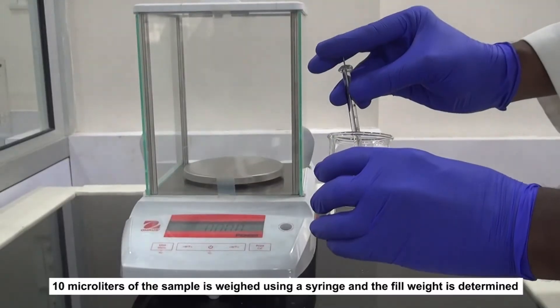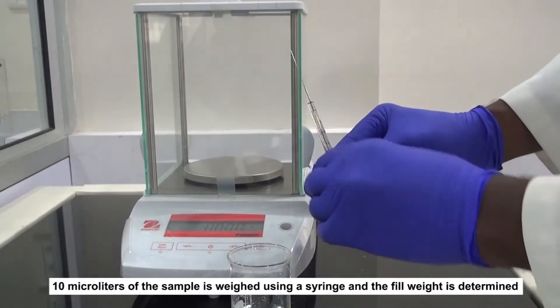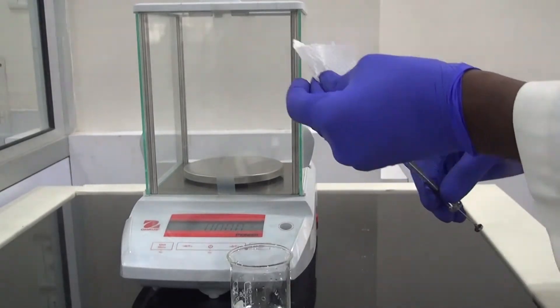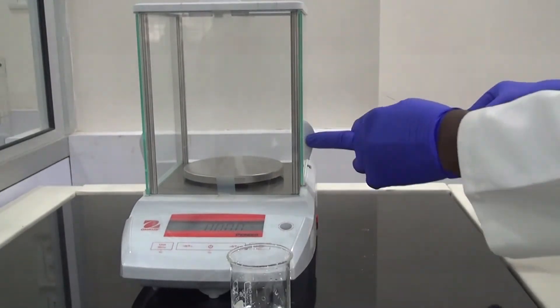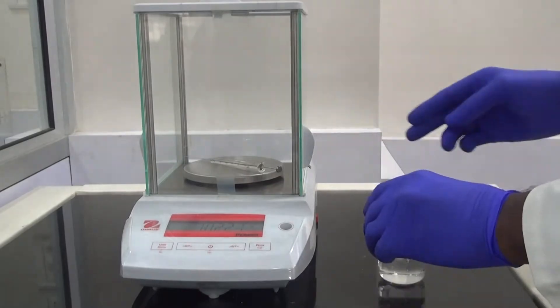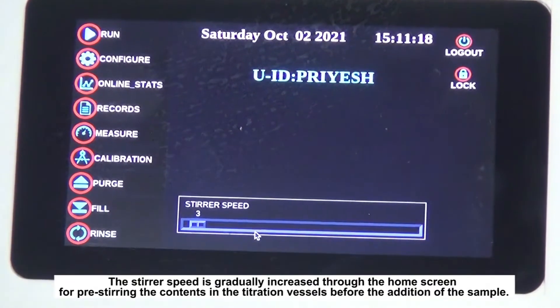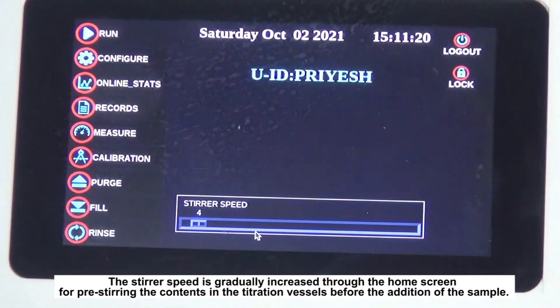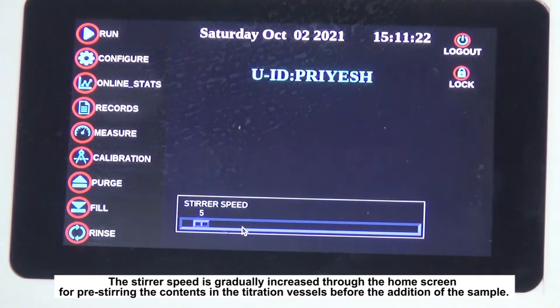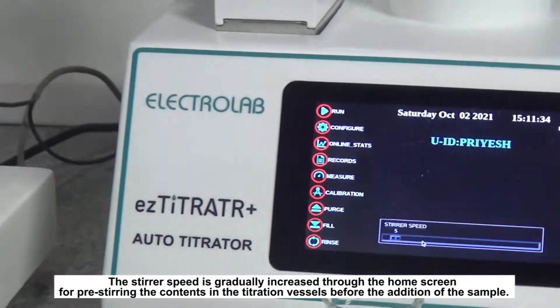The sample is weighed using a syringe and the fill weight is determined. The stirrer speed is gradually increased through the home screen for pre-stirring the contents in the titration vessel before the addition of the sample.